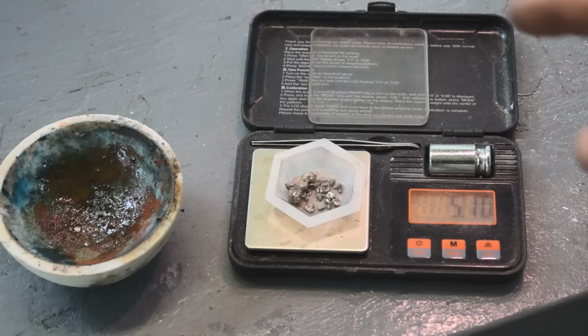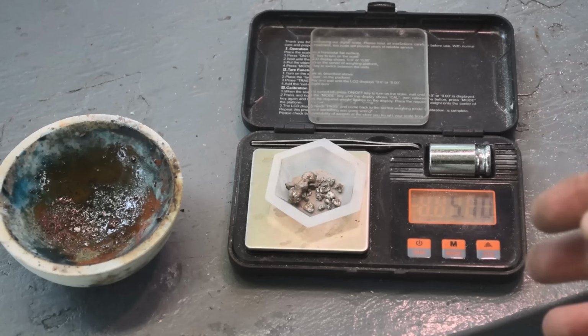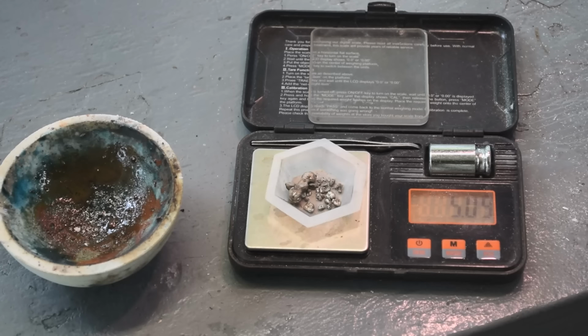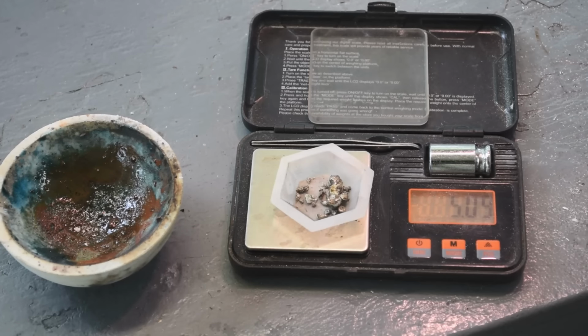I will sublime away the palladium ammonium chloride in my furnace and get palladium sponge again. That's worked for me in the past. Or I'll use DMG and I'll sublime it away in the furnace and get palladium sponge that way. Not going to try and melt it. At least not until I get a much hotter torch. So yeah, palladium has the lowest melting point of all the platinum group metals, but it's still pretty darn high. It's a little out of my reach at the moment.